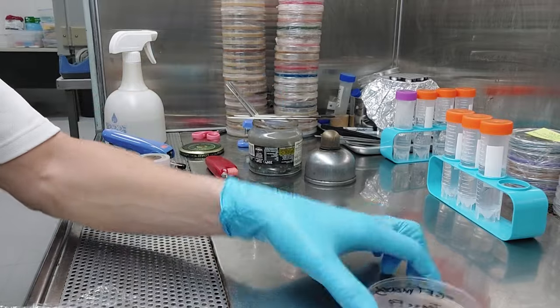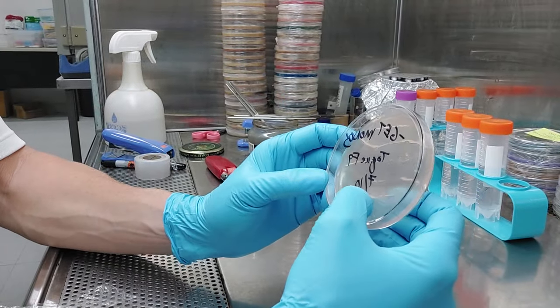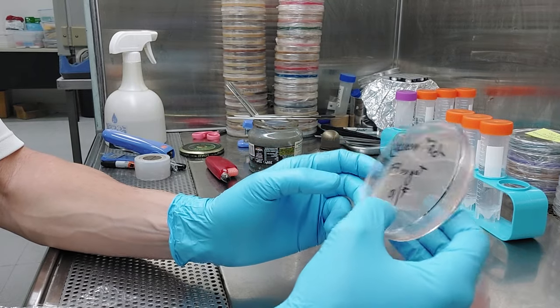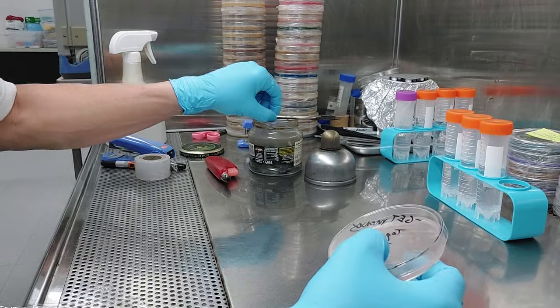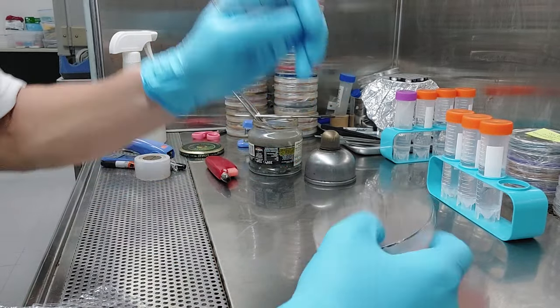One of the things I realized is I should have made this agar stiffer. I should have made like 2.5 percent, a little over 2. It was really quite hard to get in there with my number 11 scalpel blade. It makes sort of a little triangle.